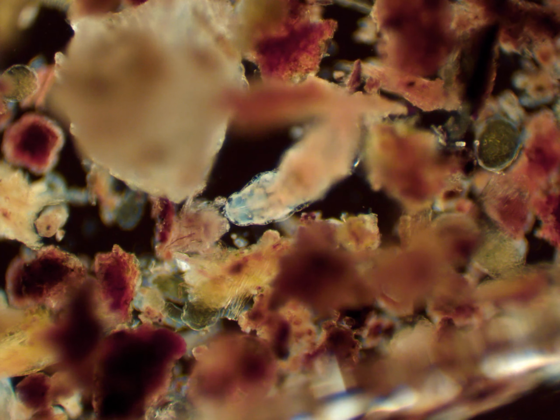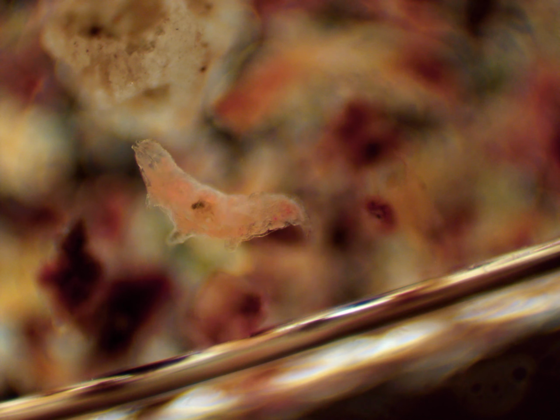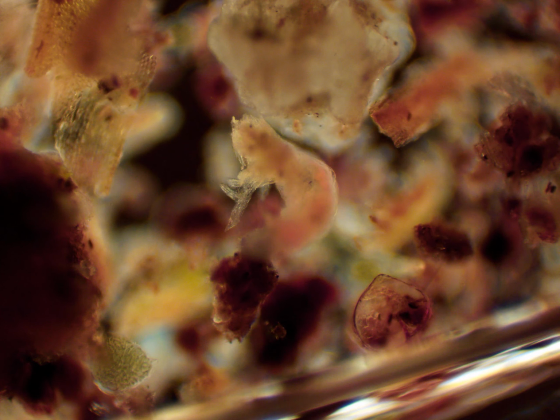You can see its legs operate, and you can see those single eye cells, which in darkfield appear black on that white and red body of the tardigrade. You can still see it swimming around. Now it's trying to grasp onto some of the sediment around it, but it's so large it's shaking all of that sediment, which makes it hard for it to move in this environment.